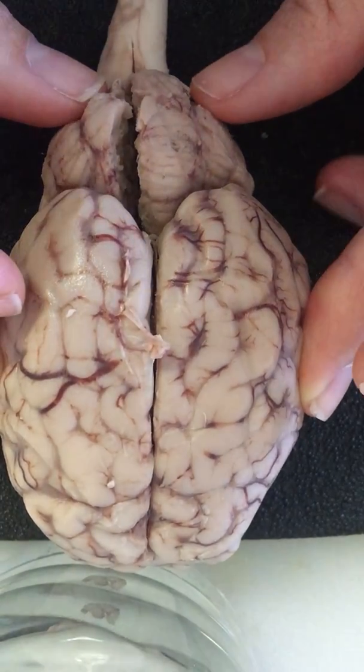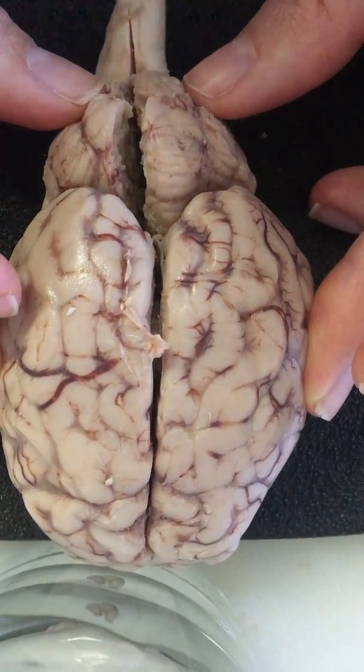Yes, I'm using my hands. I ran out of gloves, so I apologize, and I'll scrub really hard.